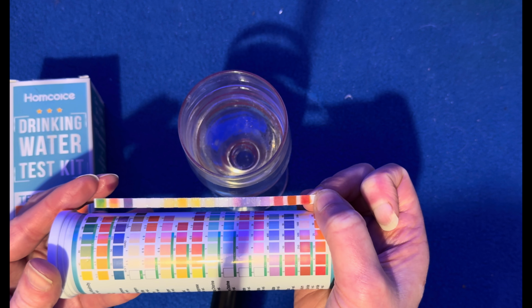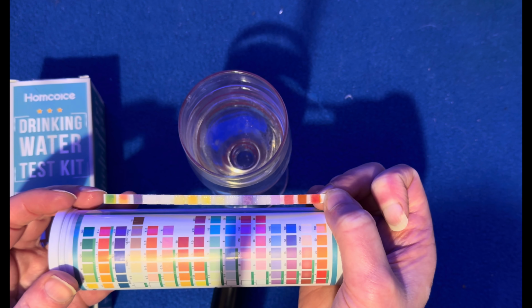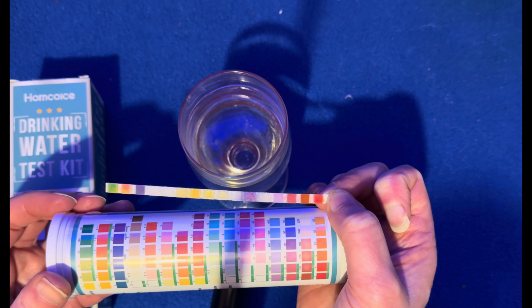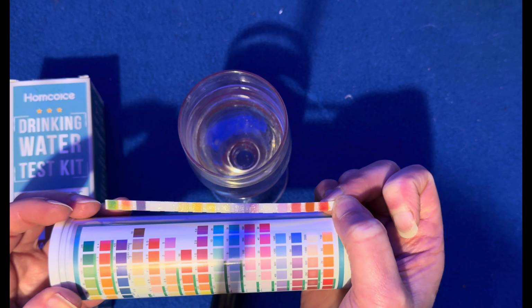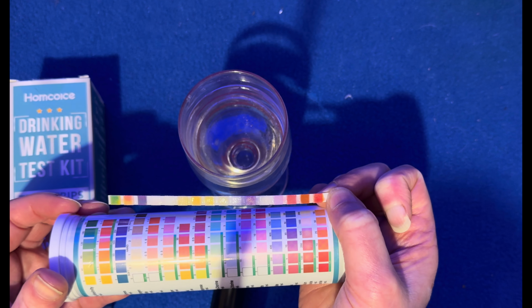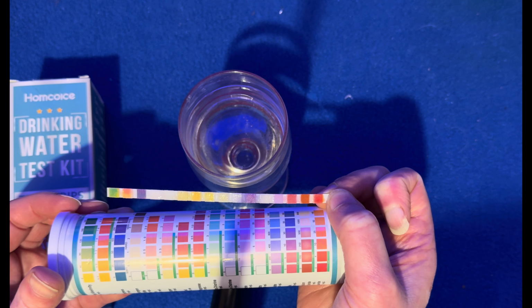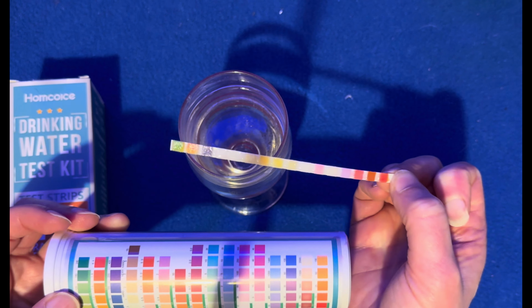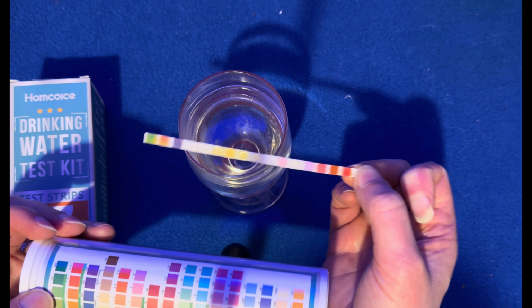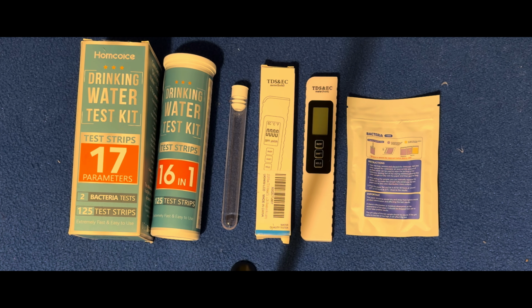No nitrites. Now down to sulfate. So a trace amount of sulfates, no zinc, no salt, and no fluoride. So the spring water as well has got very little mineral content, so yeah, nothing harmful in there.